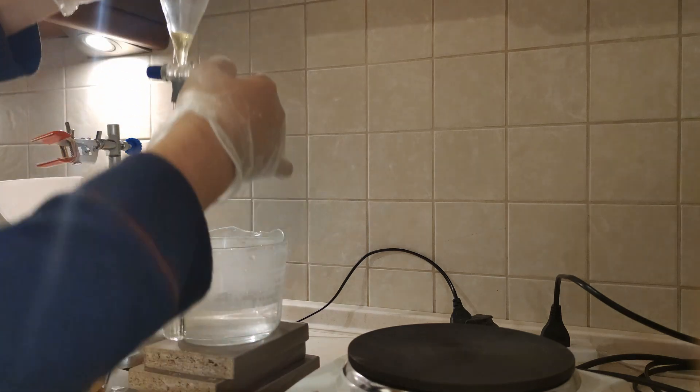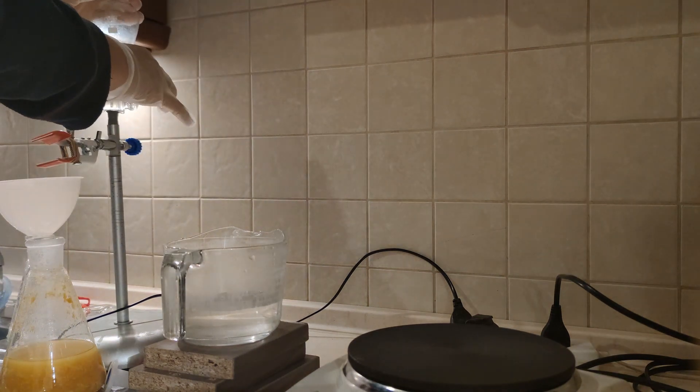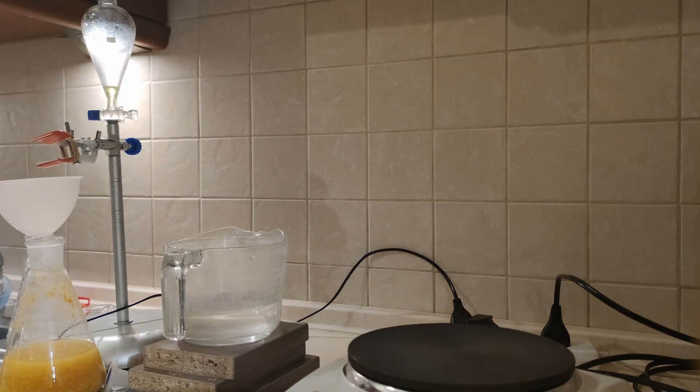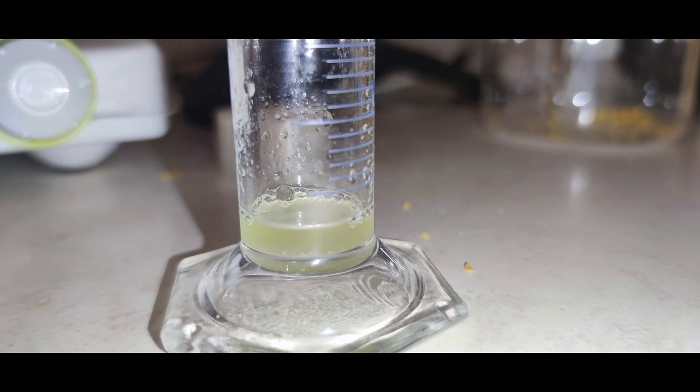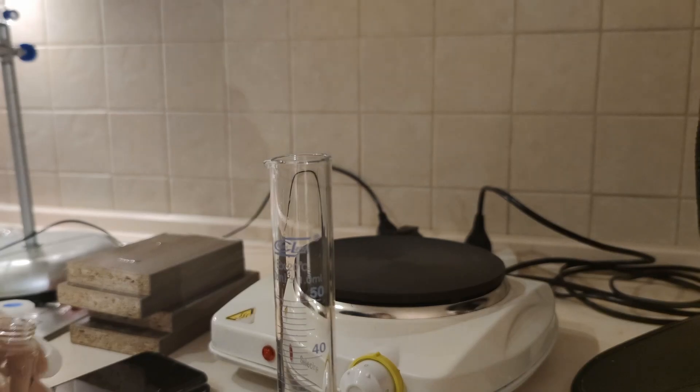I pulled the limonene into a graduated cylinder to measure my yield. I got about 3 mL of product. The limonene was then transferred to a vial for storage.